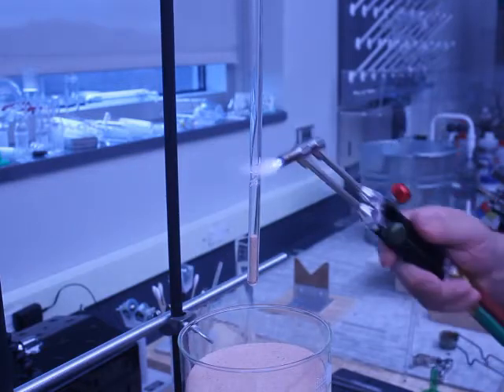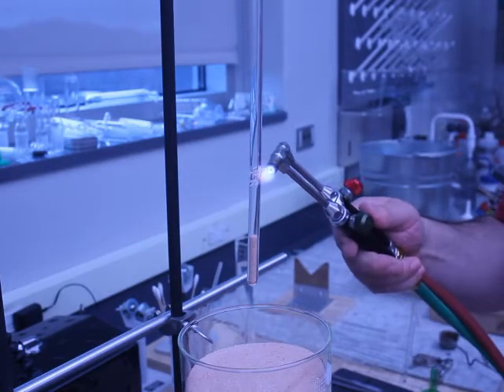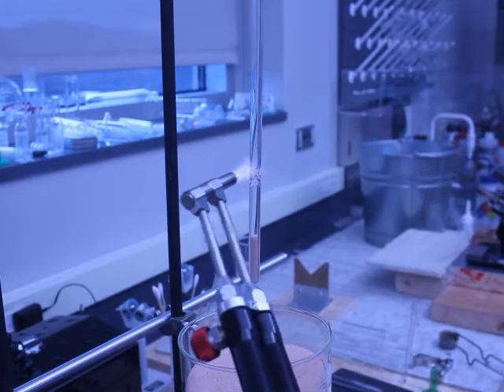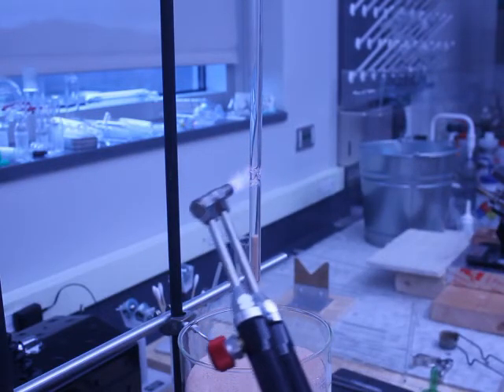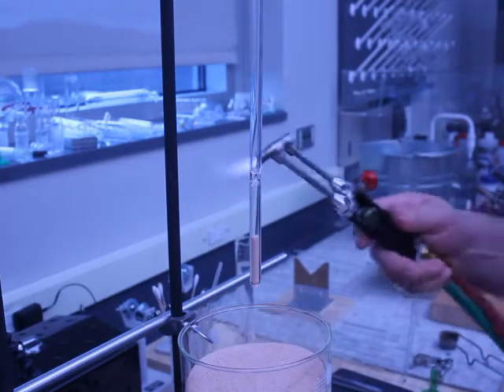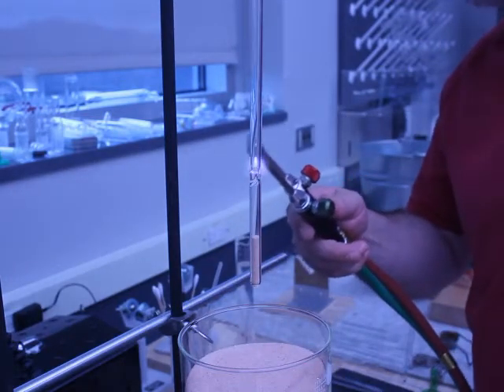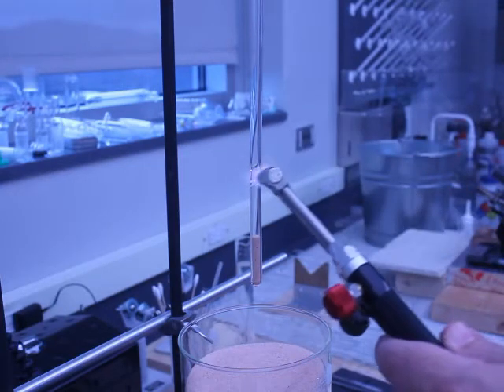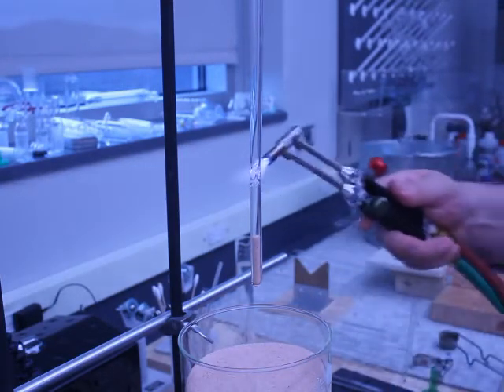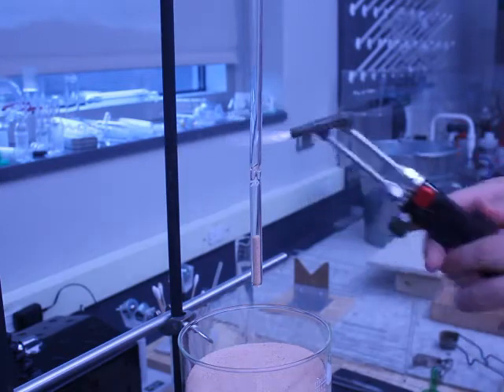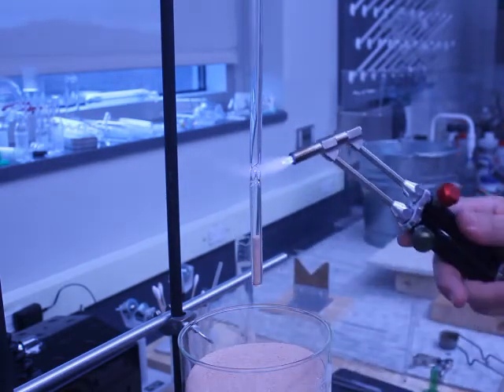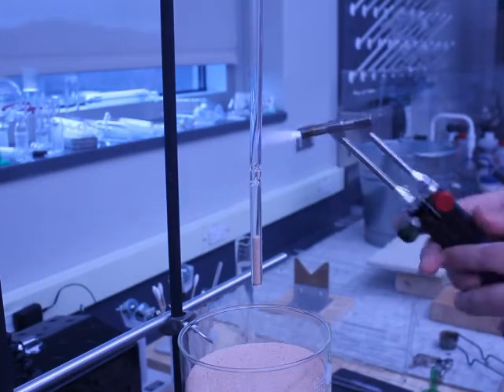And in many cases, when I'm heating the glass tubing, instead of pointing the flame directly at the tubing, I'm hitting the tubing with a glancing blow or very quickly going across because I want that tubing to be hot enough to move, but not so hot that it collapses on itself and pops. And I'll do an example of that later. I actually showed my students what happens if you heat up your sample too fast.